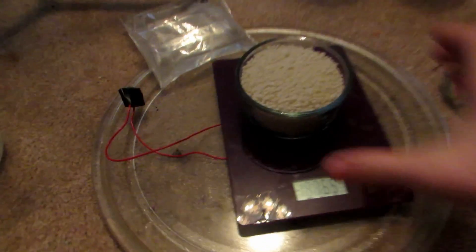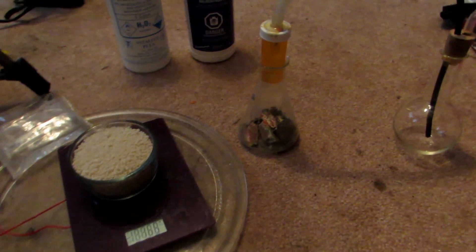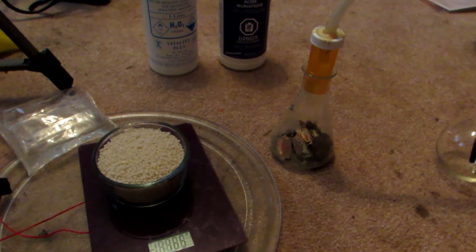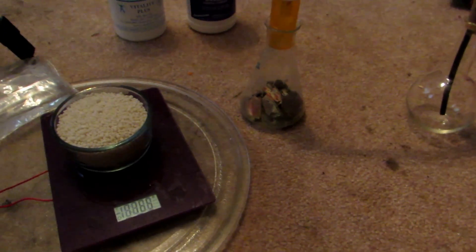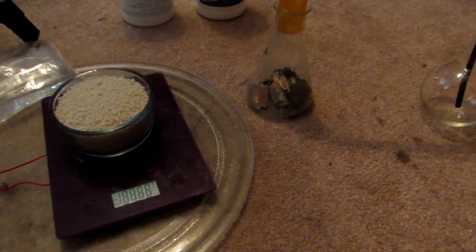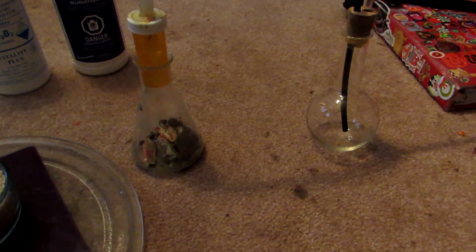What we're going to do is split this into four equal quantities. So we're going to get 40 grams of calcium ammonium nitrate added in here, and dissolve it with just enough water to completely dissolve the calcium ammonium nitrate — that's probably going to be about 25 milliliters or so. We're going to shake that really well. Now that's going to get really cold, so we're going to stick it in some warm water for quite a while to warm it back up to room temperature. And then I'm going to also add a bit of hydrogen peroxide in here. You could add however much hydrogen peroxide you want — it doesn't really matter. I'm going to use a fair amount because I'd like to get a fair amount of nitric acid from this.